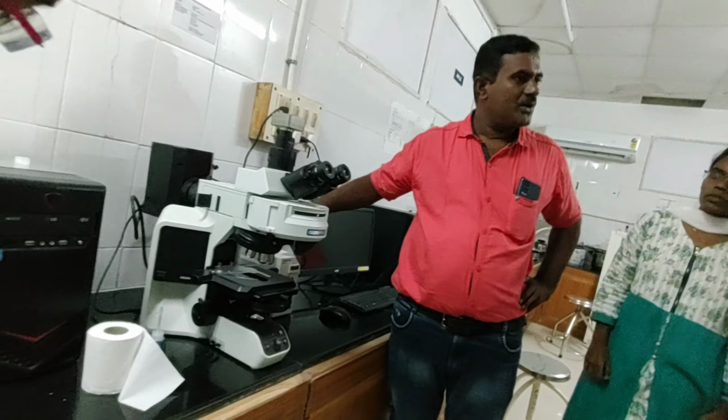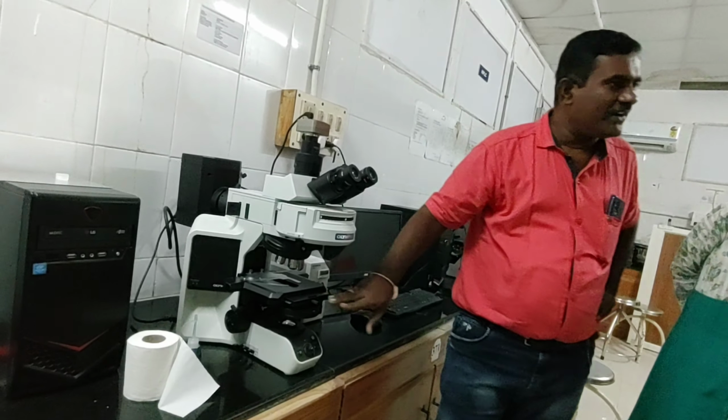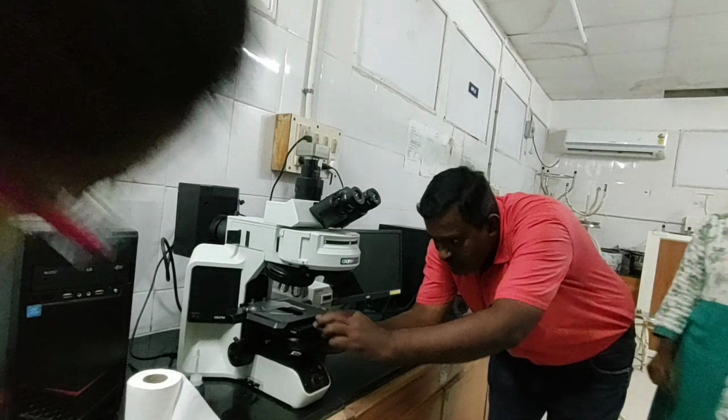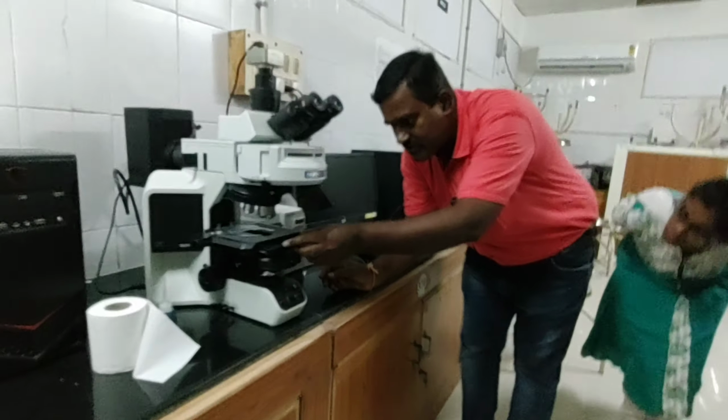The power system, now we need to start this one, then we need to close the bright field as well as the dark field. So just now I closed that one. How the field is going to be set here, so I was going to set down, see this one. This has to be closed.